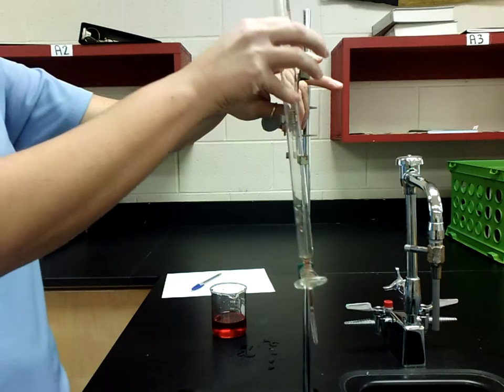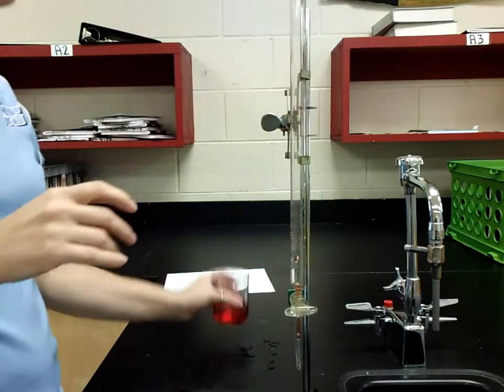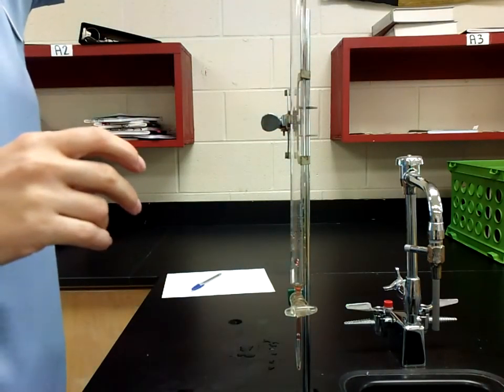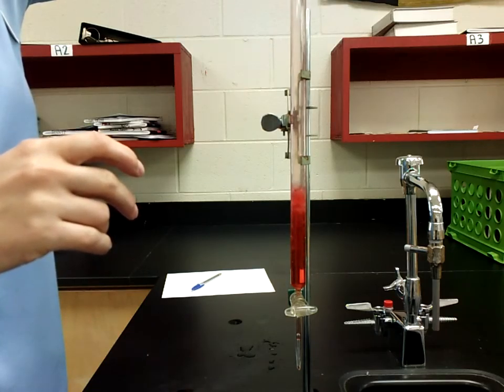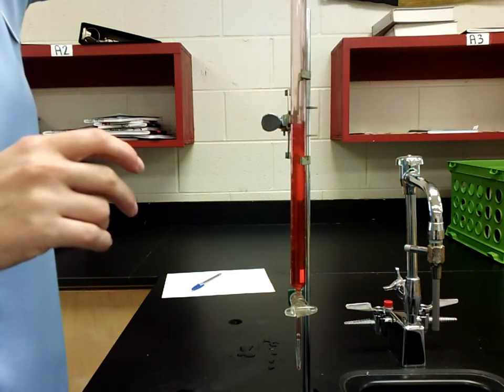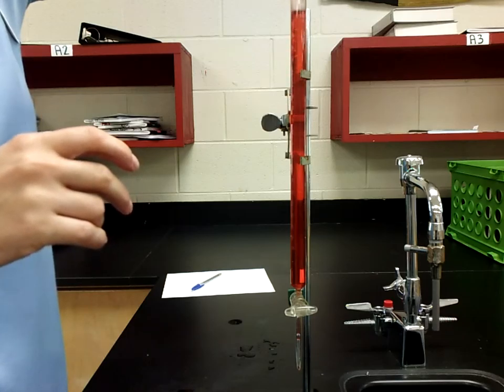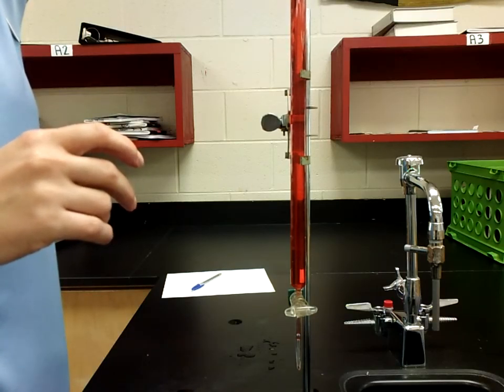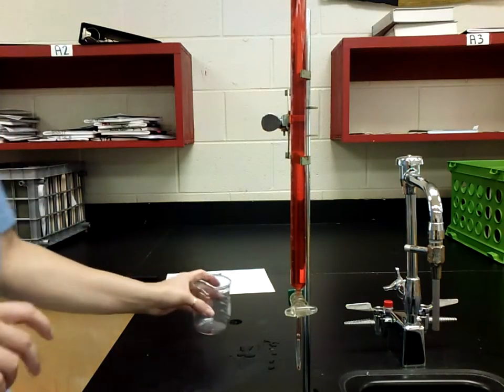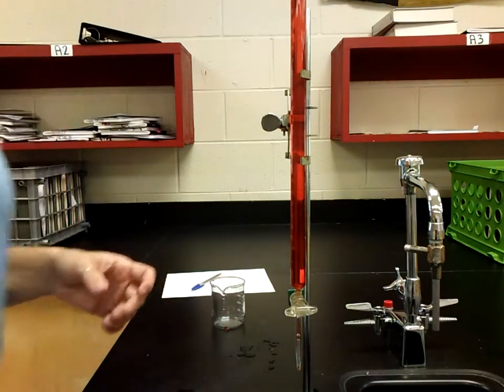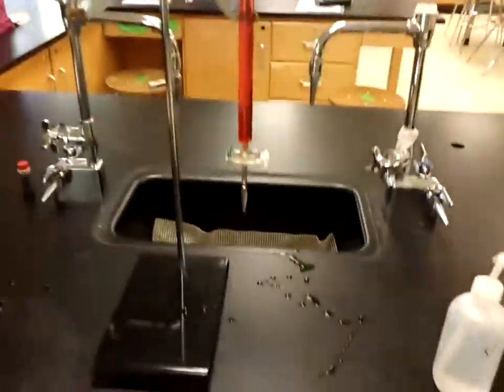All right, so when you fill up your burette for real, you want to put, it doesn't really matter what volume you get to. We're always going to be taking a reading of volume after that, but I'm going to go ahead and fill this up for the most part all the way to the top with my liquid. One of the important things to notice about my burette, so once I've got it filled, notice how I've got all my red liquid going all the way up through the top.